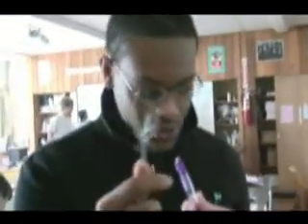Anyway, these are the paper clips that we use for the flame, and that was quite all right. It was quite fun, and that screen might show the excitement. But me, I personally felt like it was a good experiment, but I just didn't want to get burned. I was kind of running away from it sometimes. That's scary. But I did not want to answer the questions because that's too complicated. Because it wants the chronological order of these things, and that's just too much work sometimes on a Friday.